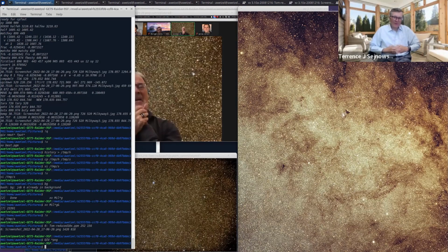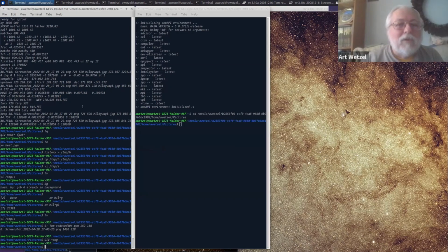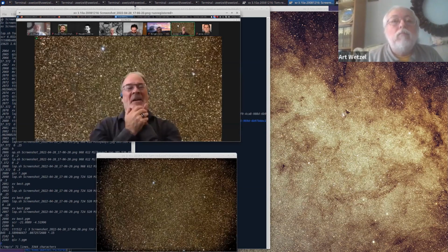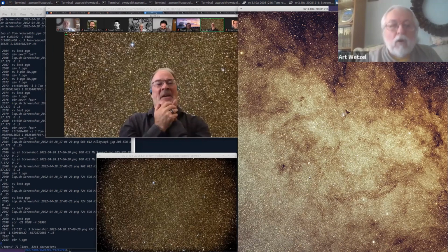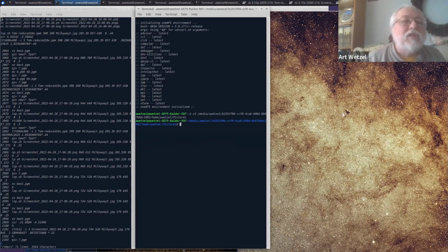Okay. So let's get to it and actually run some things here in the normal way that I do things here. So we have these couple of images. Boom, boom, boom. So let's start off with confirming the match between this image and this image. And excuse me, I really should put these things into PowerPoints. It would save us all time.